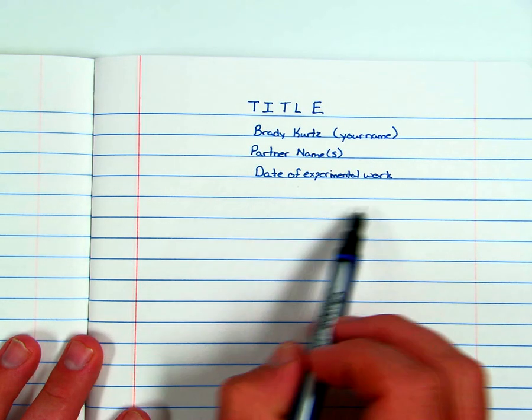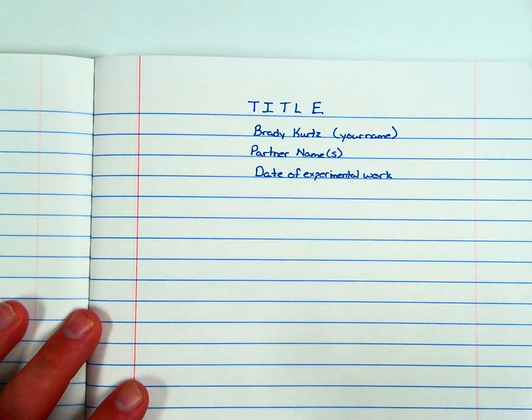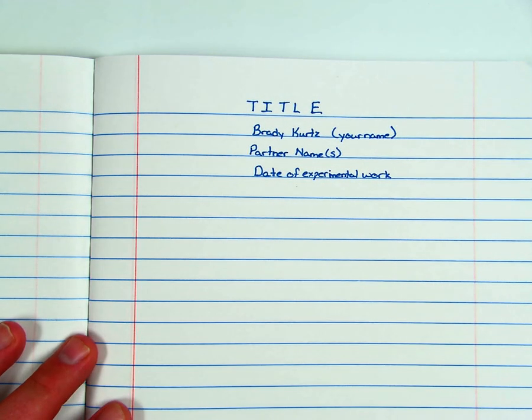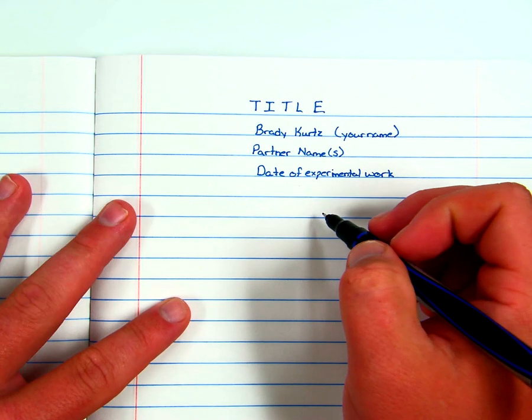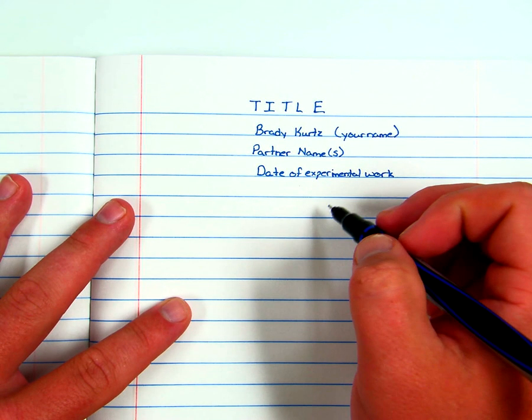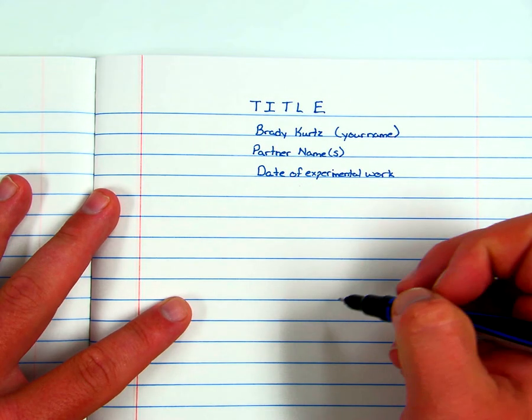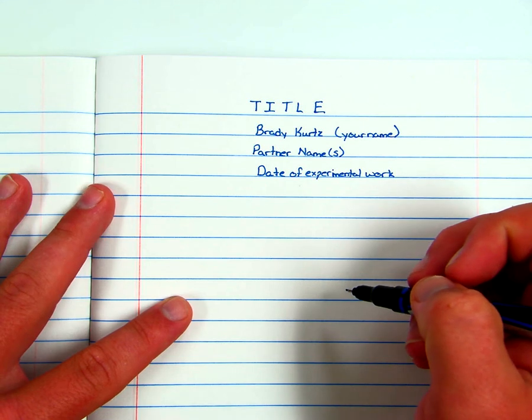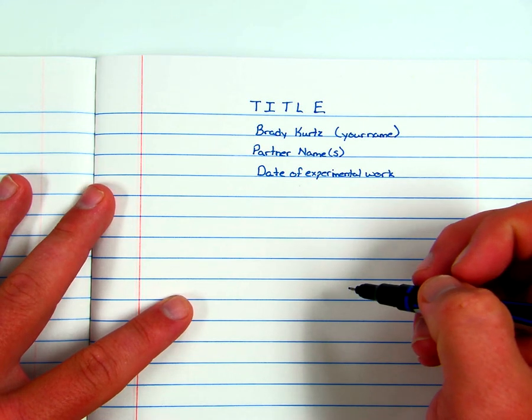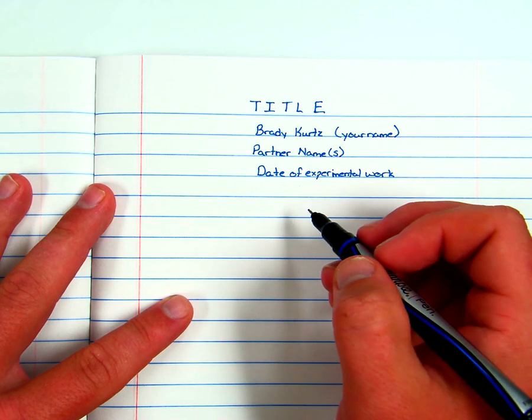Okay, so it might be just one day, it might be a couple of days to put in there. Alright, so there's our heading. I would really recommend skipping a couple lines. In fact, I would say it's required that you skip at least one line between these sections because we want to keep it nice and neat. While some of you don't have the best handwriting, there's no reason that your notebook cannot be neatly done, because it doesn't take really that much work. So I'm going to skip a line or two here.